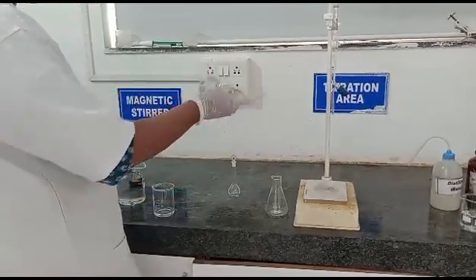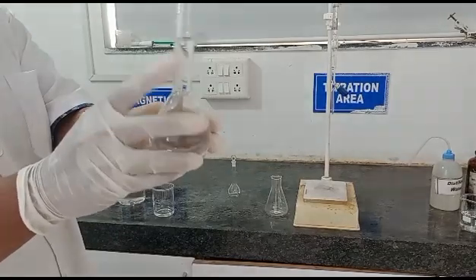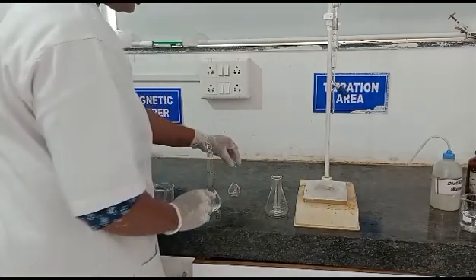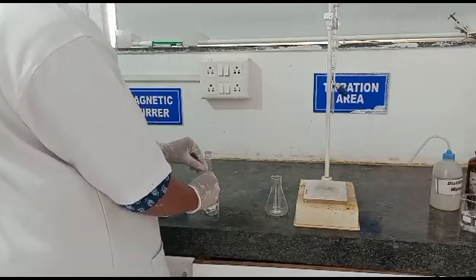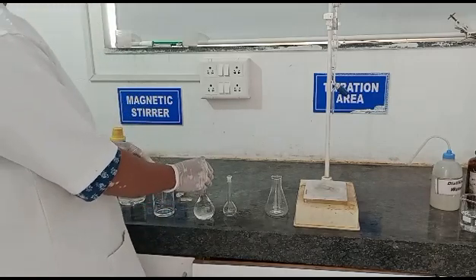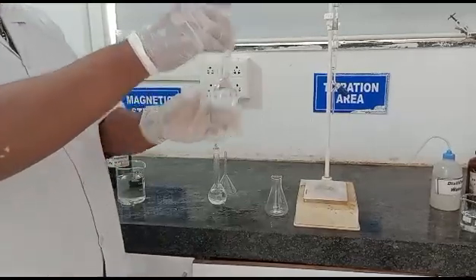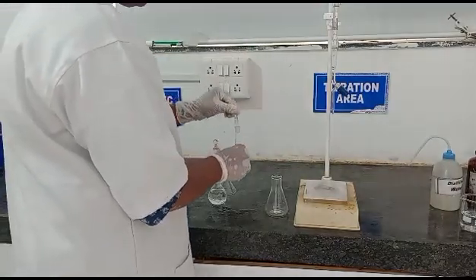Now check this solution carefully — you can see we have diluted it up to 100 ml. Now we will take a 25 ml aliquot from this 100 ml for standardization. In another 25 ml volumetric flask, we will transfer the aliquot from the stock, that is from the 100 ml solution. This is the final 25 ml of aliquot which we are going to take for standardization.